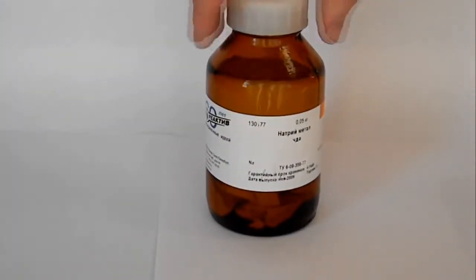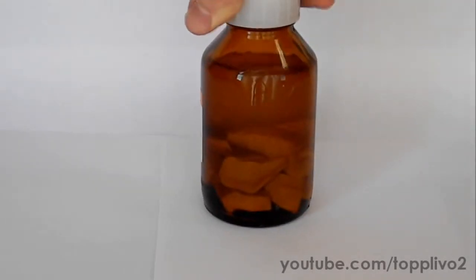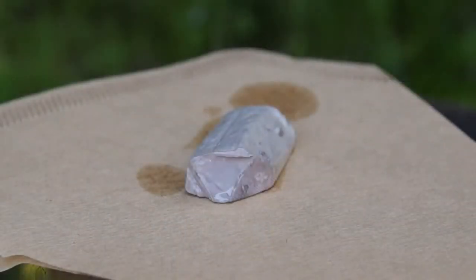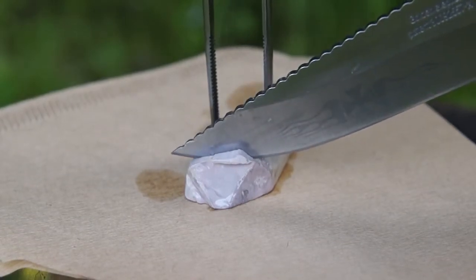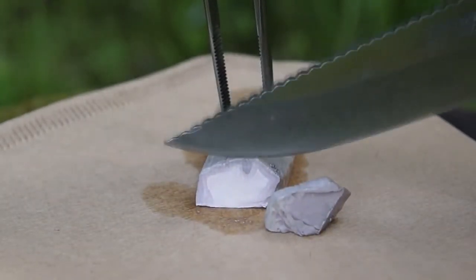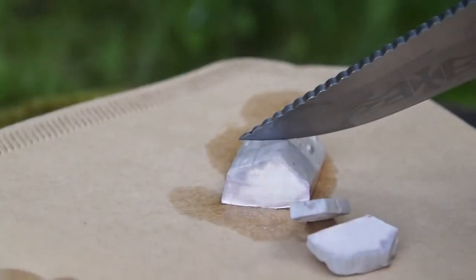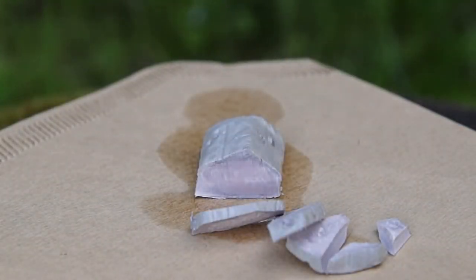Please note that this video was made solely for demonstration purposes. Do not attempt to repeat the experiments shown in this video. Hello everyone! Today I will conduct various reactions with the metallic sodium. I finally managed to buy it, so I expect this video to be quite interesting. As you can see, sodium is stored in kerosene in such a jar. We need to take a piece of sodium and put it on a filter paper to soak the remaining kerosene. First, I'll tell you about the physical properties of sodium metal. Density of sodium is almost the same as water, melting point being 97 degrees Celsius. Sodium is a quite soft metal and can be easily cut with a knife. Hardness of sodium is almost identical to an eraser that you use in schools — it requires the same effort to cut it. On the cut edge you can see the shiny surface of sodium. However, being in the air, it oxidizes very quickly.